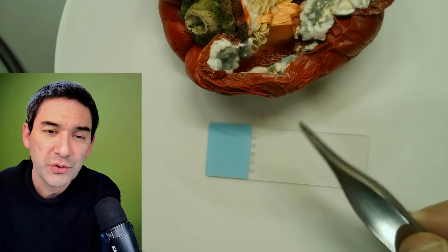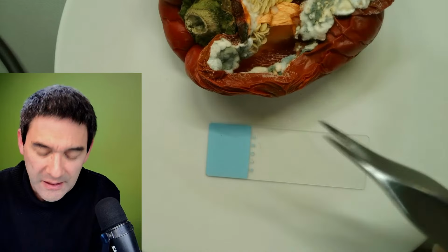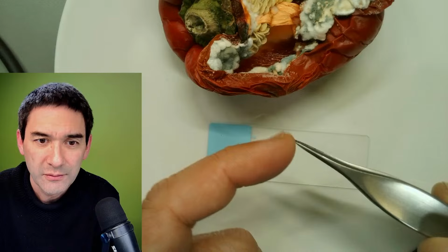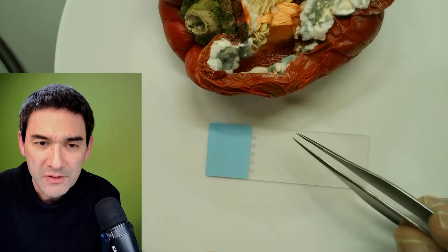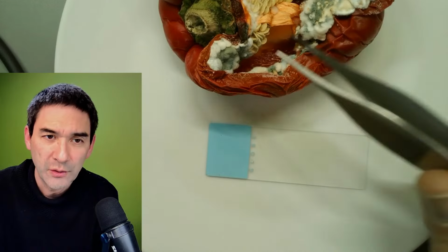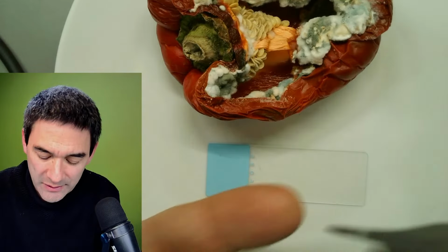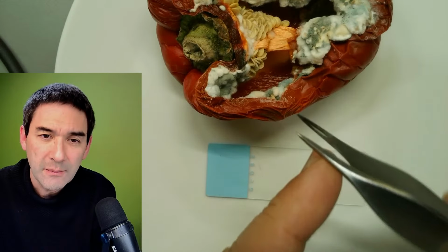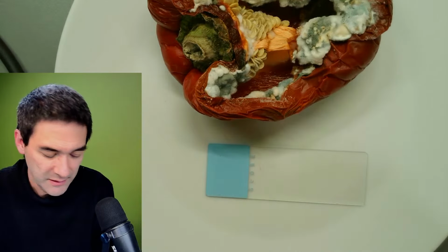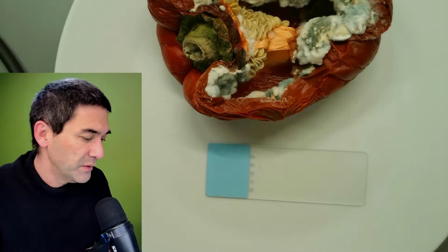I like using those tweezers a lot, right? They're super practical and convenient, but they have one huge disadvantage, and the disadvantage is they're really pointed, right? They allow you to pick up small objects, but you can also hurt yourself. And of course, if you now mess around with stuff like this and then you hurt yourself, you're introducing bacteria. You don't want to do that. So I'm just saying, be careful with this, because things like this happen, right? And that's why some basic hygienic measures are always good.